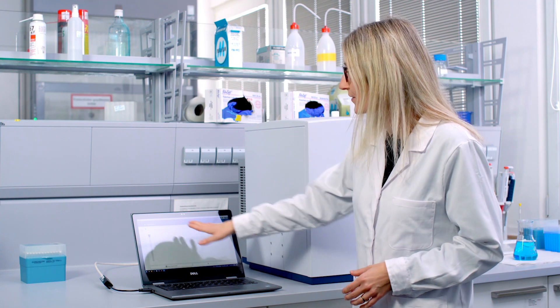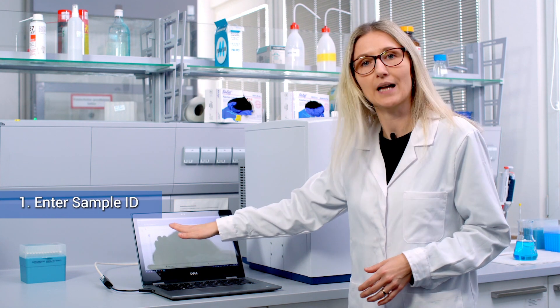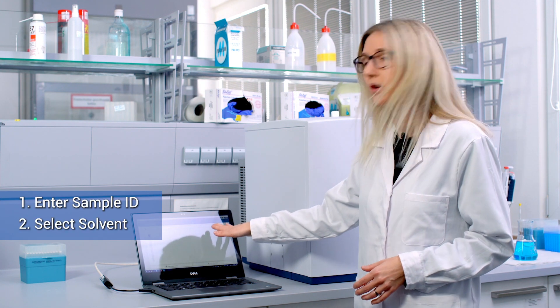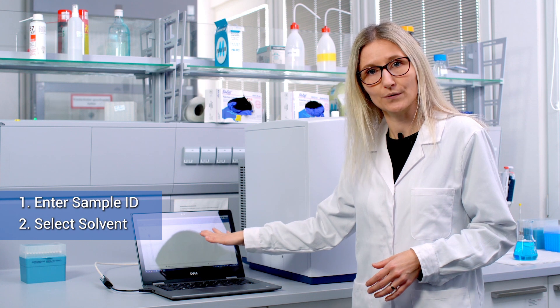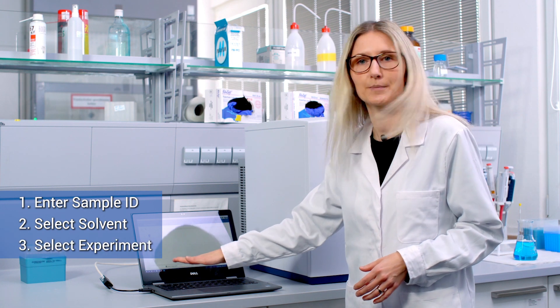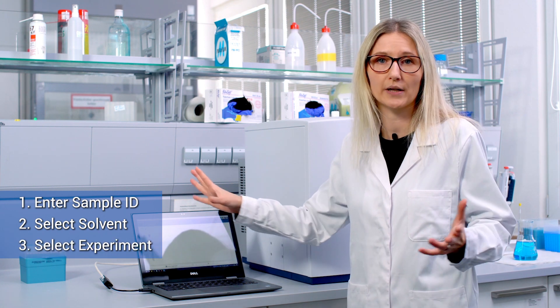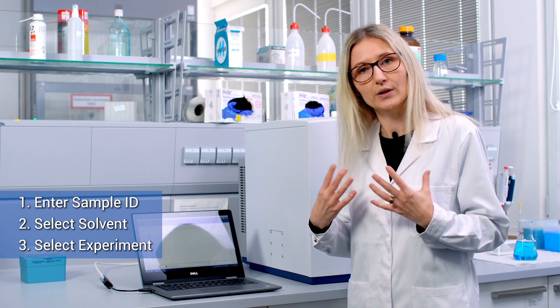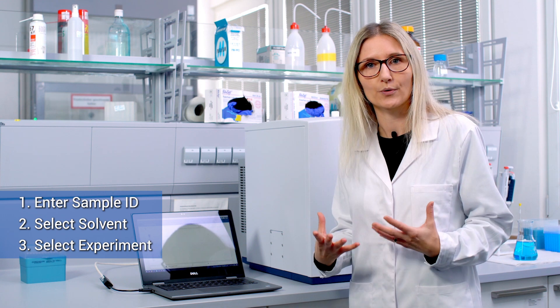You just need to enter your sample ID, select the solvent that you have used for your sample, and then you can select an experiment or several experiments based on our Bruker Pulse program experiment library.